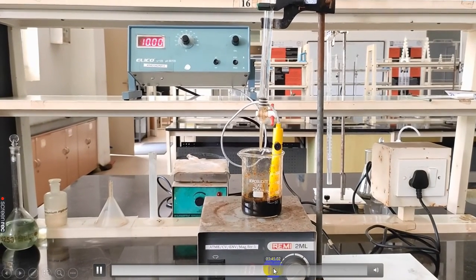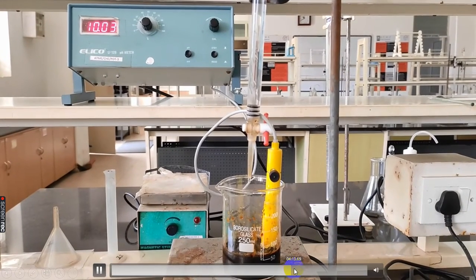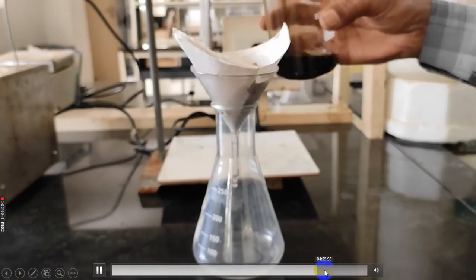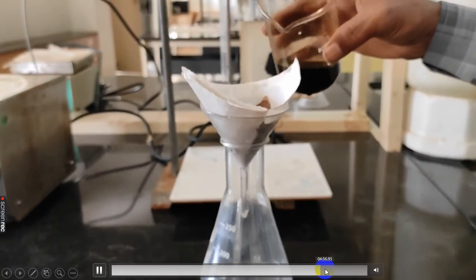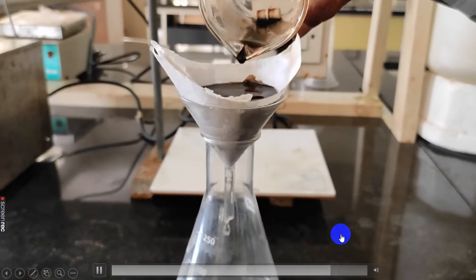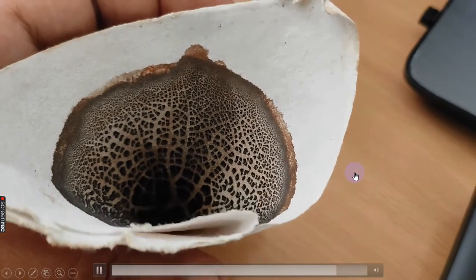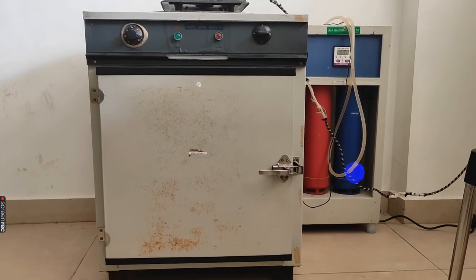Now the resultant solution — the black precipitate — is filtered using a Whatman filter paper. It is filtered by multiple washings with deionized water.